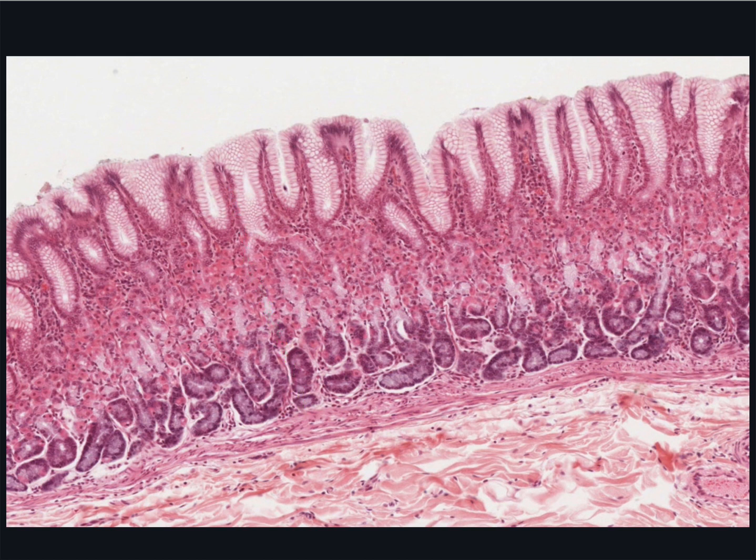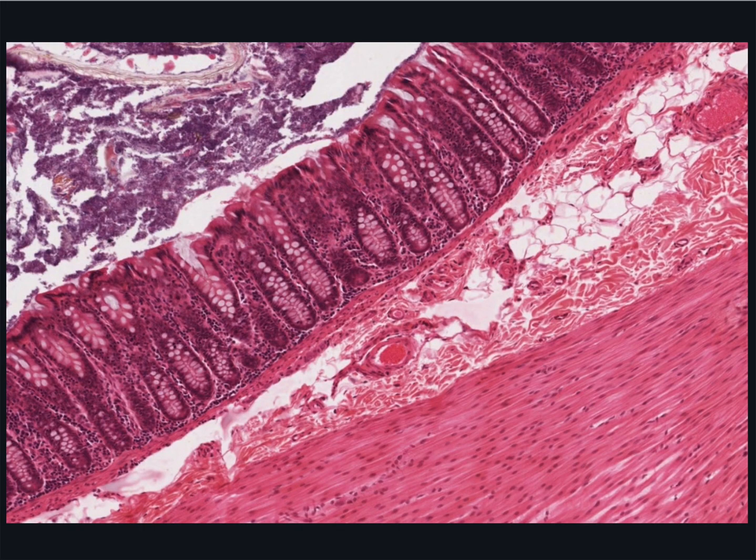And the cells are so packed together, you don't really appreciate that they're all components of glands. And here, you can see invaginations of the epithelium into the lamina propria of the colon to form these straight tubular glands.